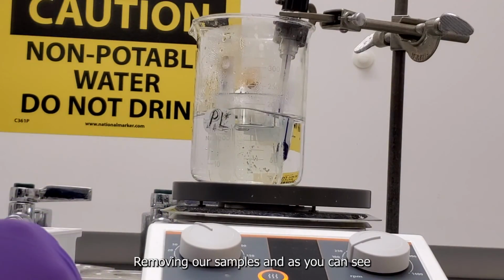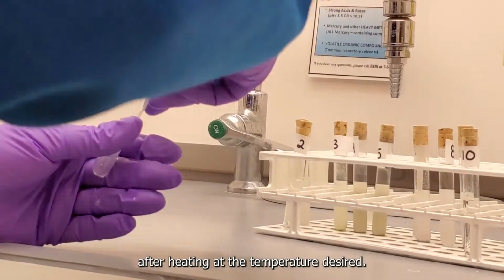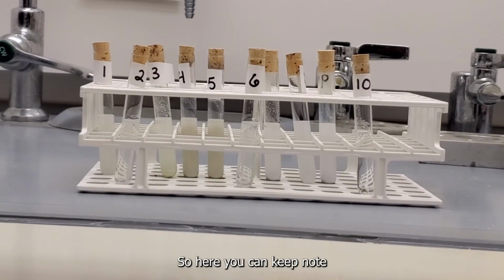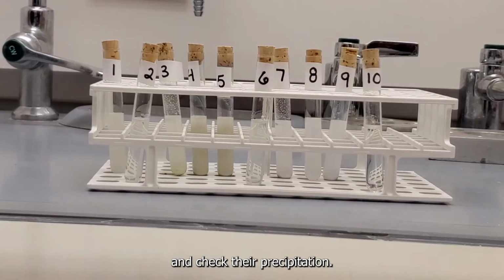So now we're removing our samples, and as you can see, there is slight precipitation after heating at the temperature desired. So here you can keep note of all the samples and check their precipitation.